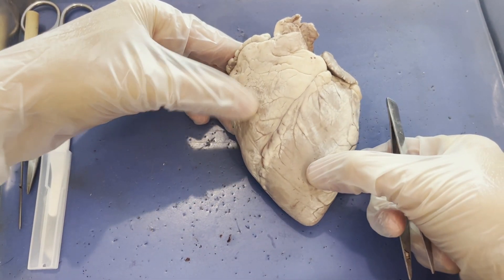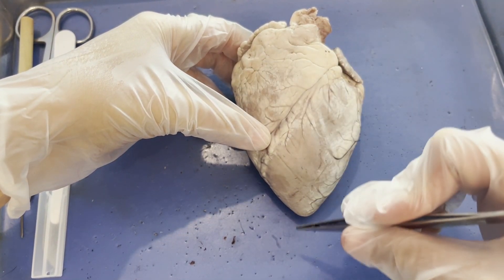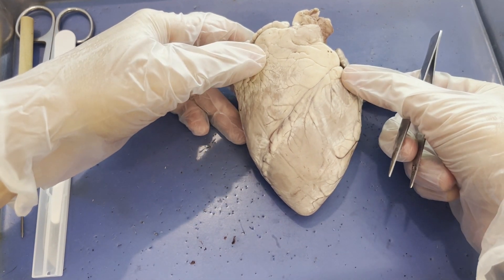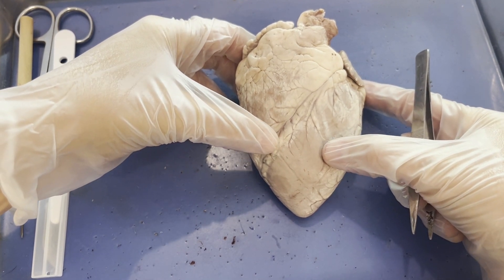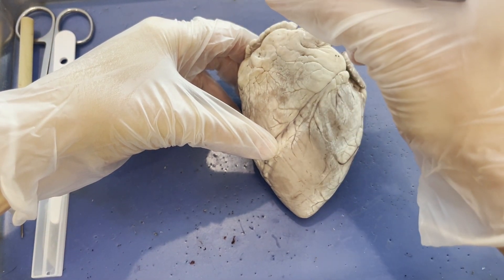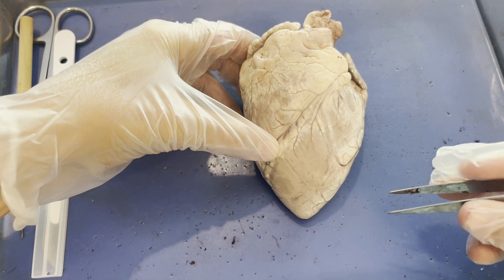Beneath the atria you will find the left and right ventricles. An easy way to remember that the ventricles are at the bottom is that the heart is shaped like a V, so the ventricles make up the V. The ventricles are much bigger than the atria because the atria just receive blood and dump it down into their respective ventricles. The ventricles have the harder task of pumping blood out of the heart — the right ventricle pumps blood to the lungs, and the left ventricle pumps blood out through the aorta to the entire body.